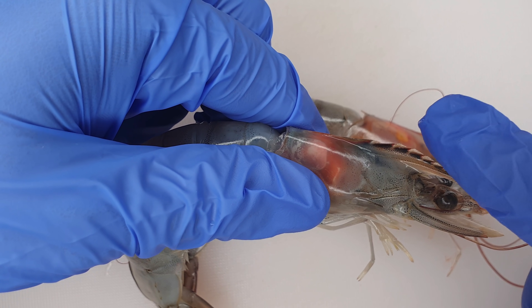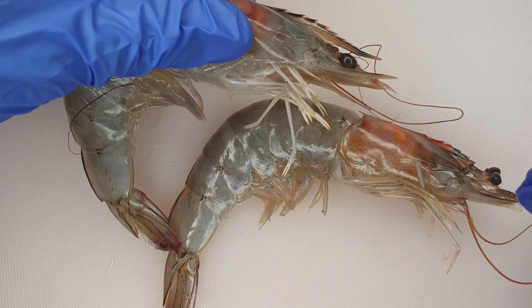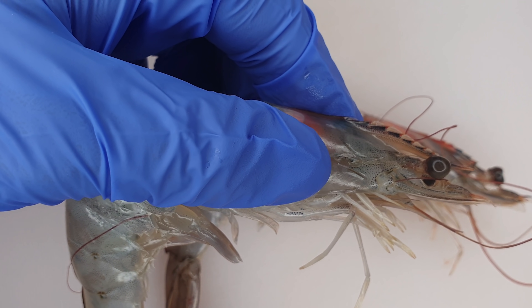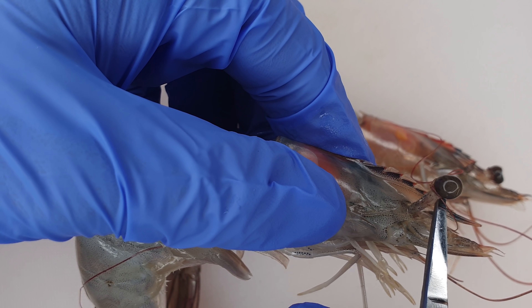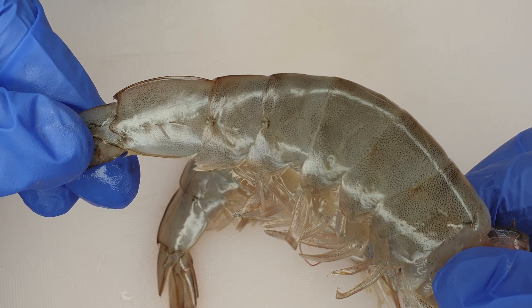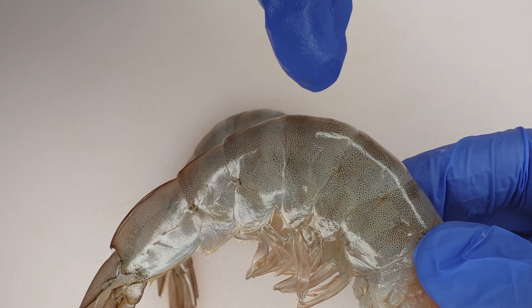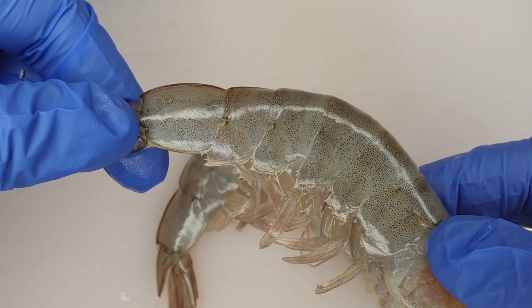According to the shape of the rostrum, shrimp species differ. They also have compound stalked eyes — this is the compound eye held on a stalk or holder. The second region is the abdomen, which is made up of six segments: the first, second, third, fourth, fifth, and sixth abdominal segments.